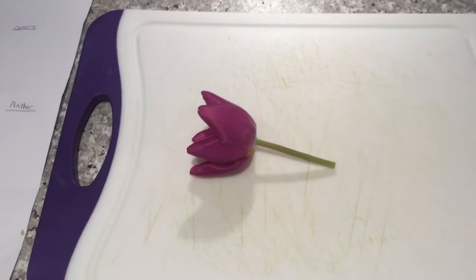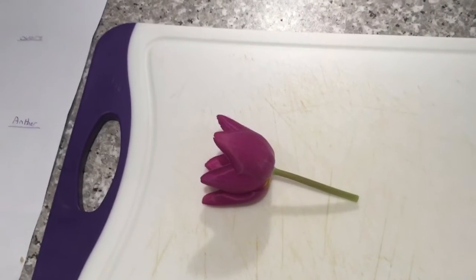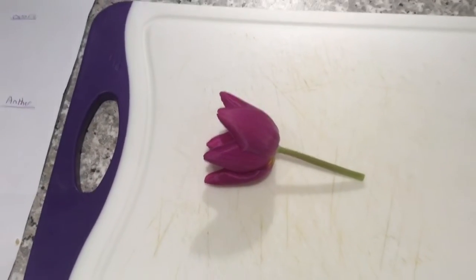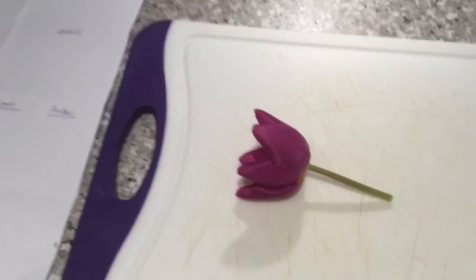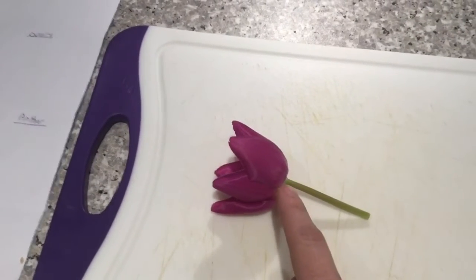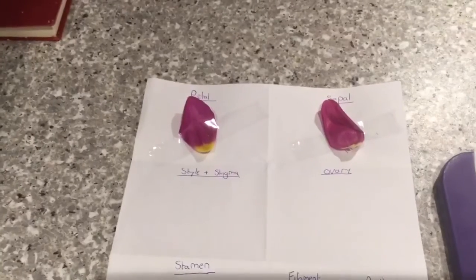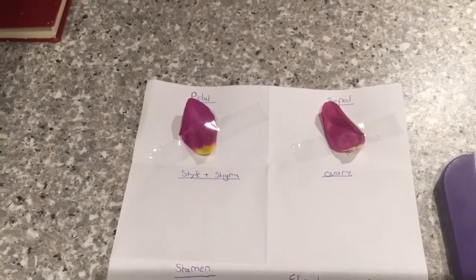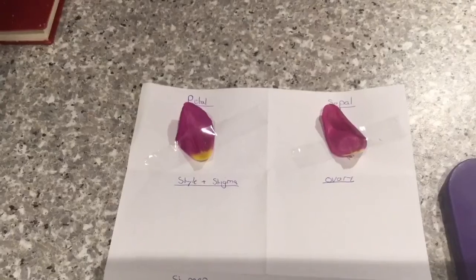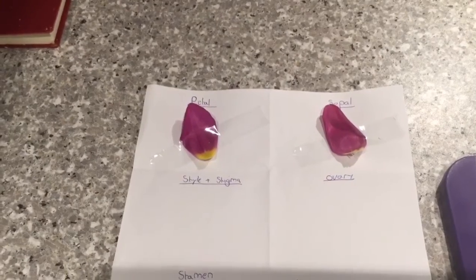The next piece of the flower we're going to look at is the sepal. This is the piece that protects the flower while it's all curled up and waiting to bloom. In this case it looks very similar to the petals — the inner ones are the petal and the outside one is the sepal. So I'm now going to remove that using my scissors and attach it onto my piece of paper. In this case both of them look very similar, but in other flowers that's not always the case. For example, a rose is protected by green sepals but its petals inside can be entirely different colours.